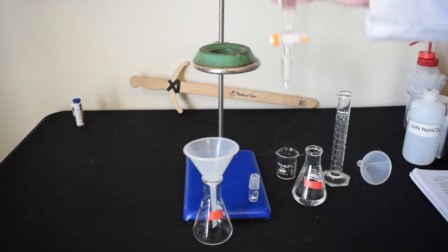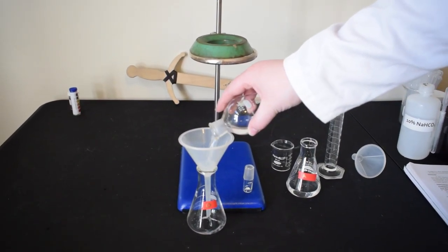And now we are going to pour the organic layer out the top of the separatory funnel.